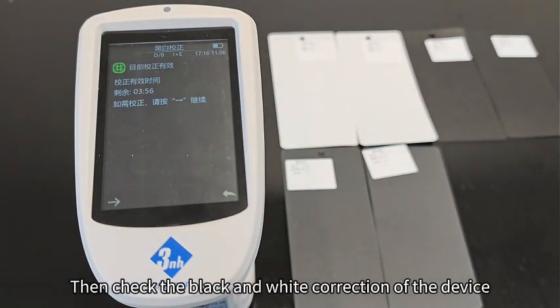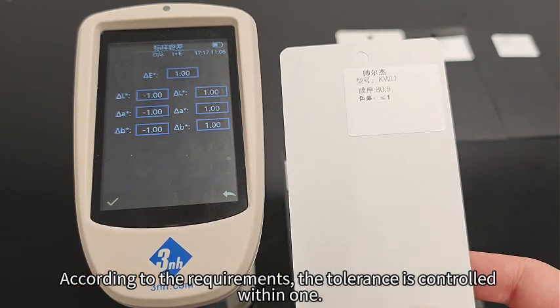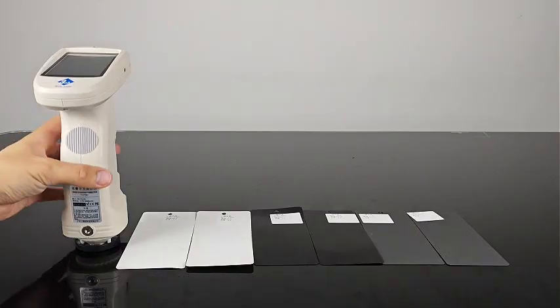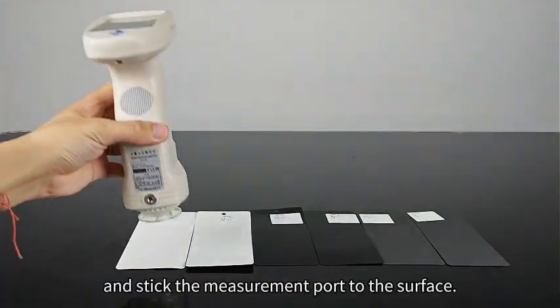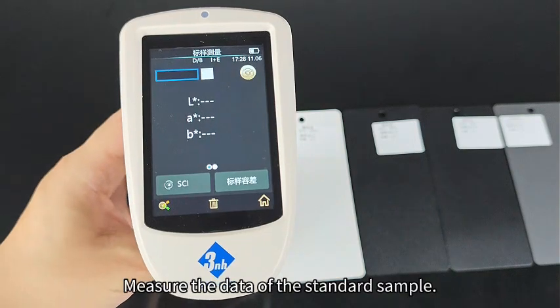Then check the black and white correction of the device. According to the requirements, the tolerance is controlled within 1. After opening the dust cover, stick the measurement port to the surface and measure the data of the standard sample.